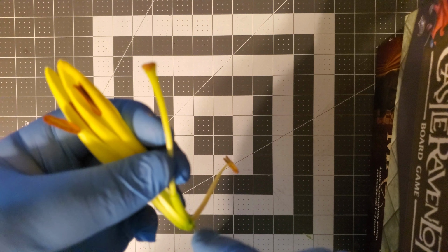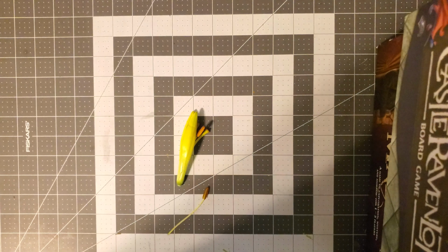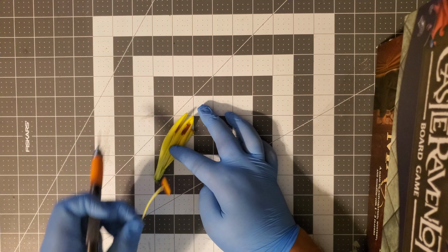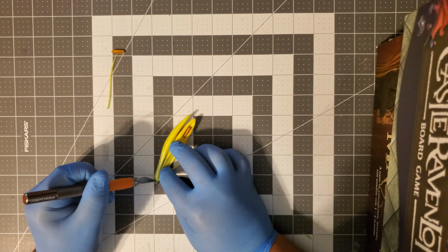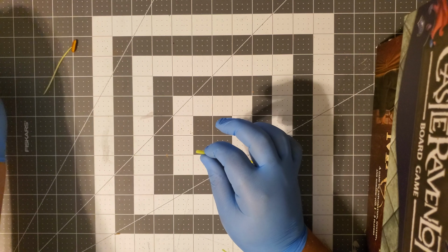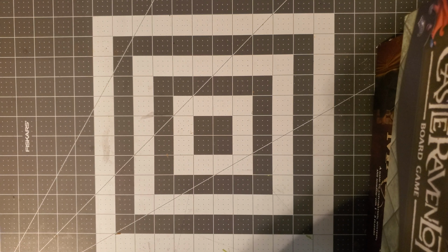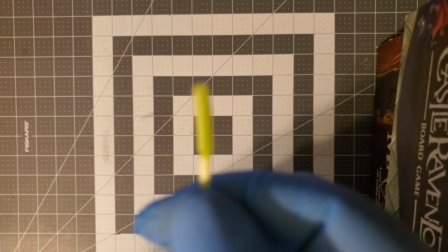Now I'm going to cut away at the rest of the stuff so we can get a clearer look at the ovary. I'm going to get down and dirty. Alrighty. So one of the filaments and anthers fell off, so let's just cut away at this. I don't want to cut that part off. But yeah, there we go. I'm going to move these out real quick. Alright, so I think we can get a close look right here.